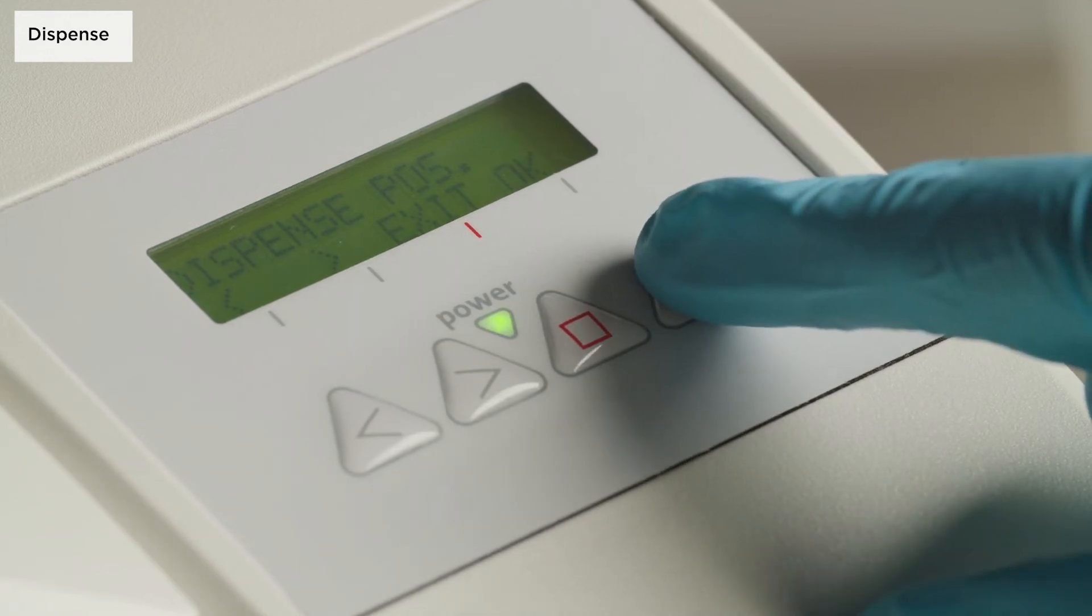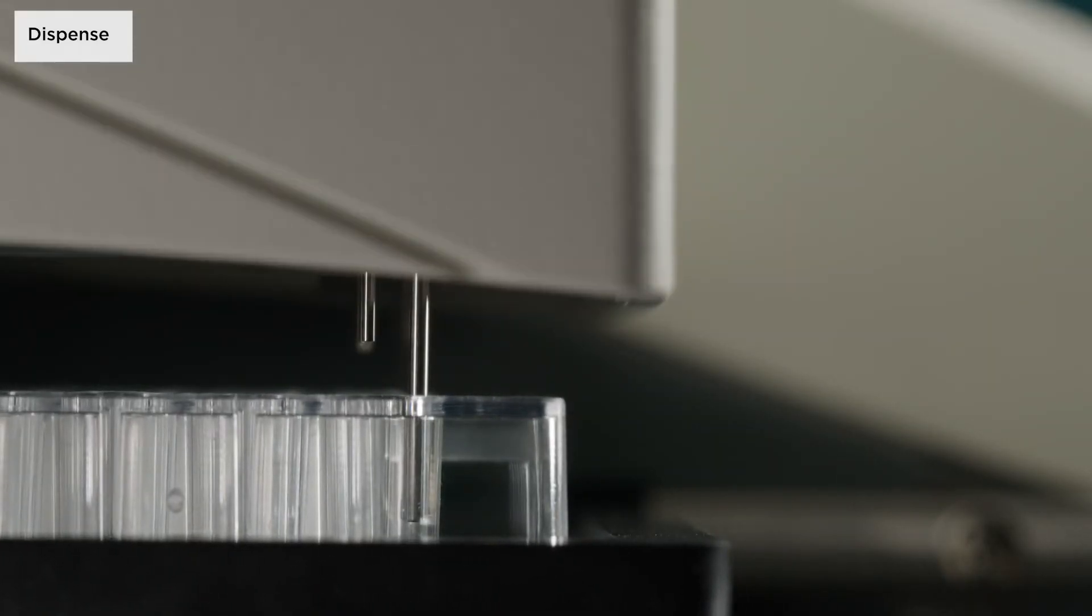The dispense position is available for all plate types and the needles should be set as close as possible to the centre of the well.